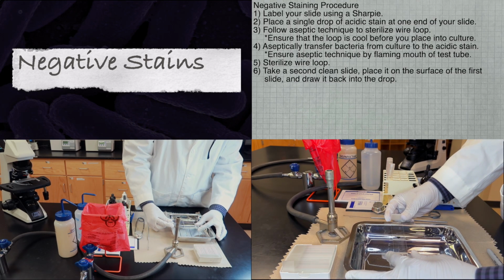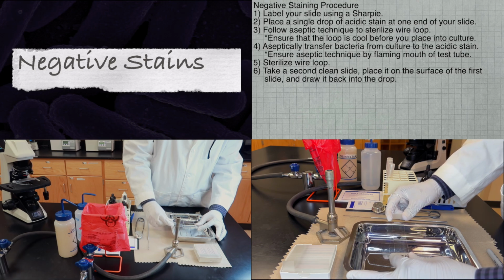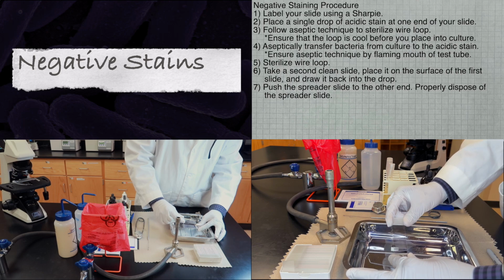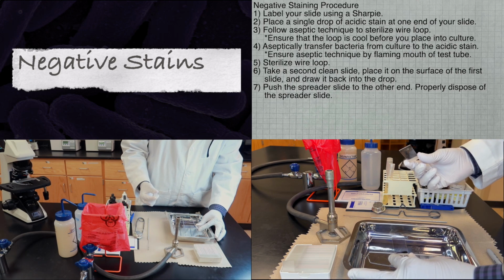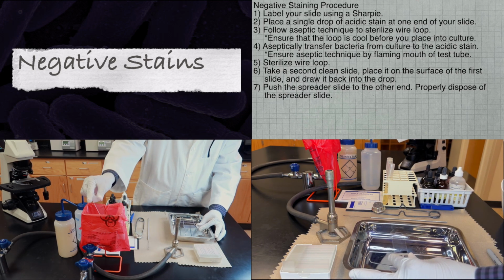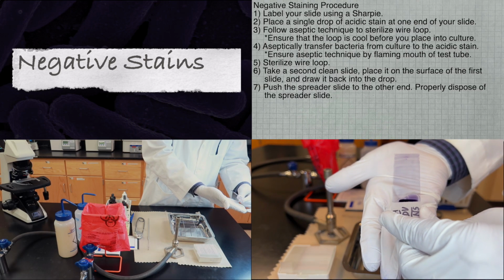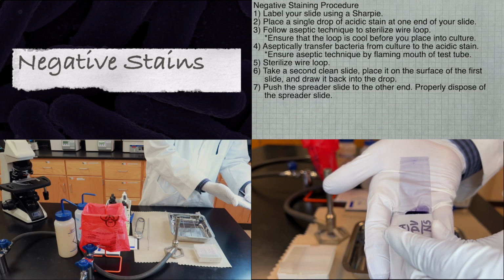Next, take a new, clean slide, place it on the surface of the first slide, and draw it back into the drop. Then, push the spreader slide to the other end, and dispose of the spreader slide in the red biohazard bag. When performed properly, your slide will appear similar to this.